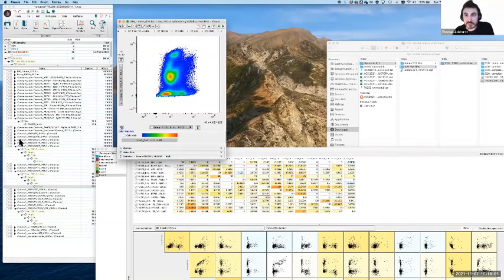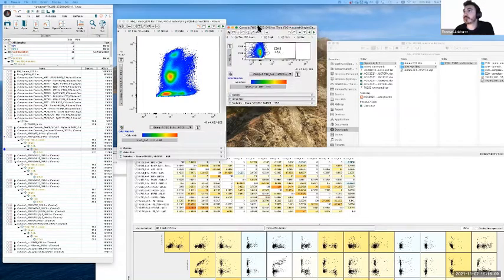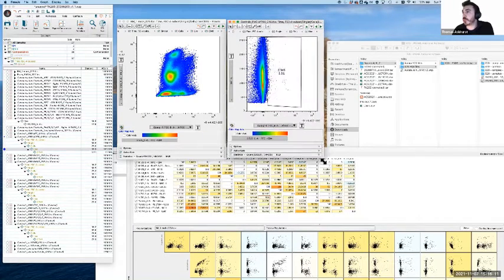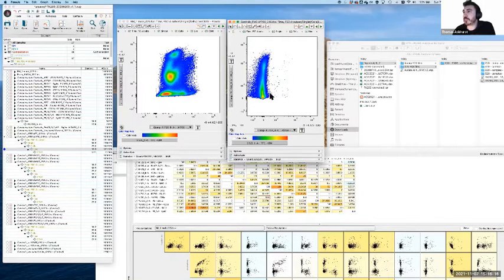Obviously with the FMO, that gives us a pretty big clue. So if we go to the FMO, or in this case, CD45, then we get an answer which actually helps us quite a bit. Notwithstanding the Ly6C problems, we actually get a pretty good clue that, if this is a bit higher, we actually do see that this is a genuine population which is highly correlated.